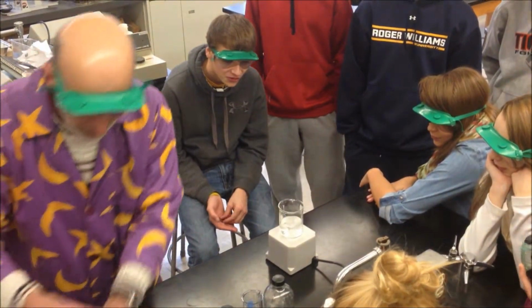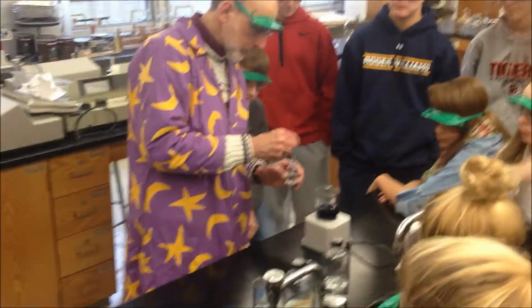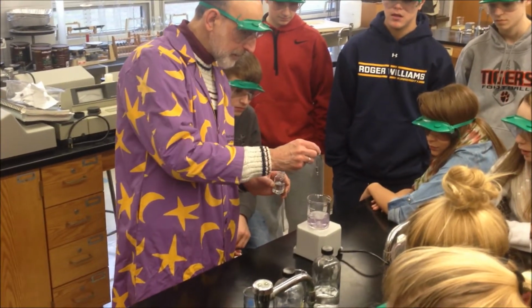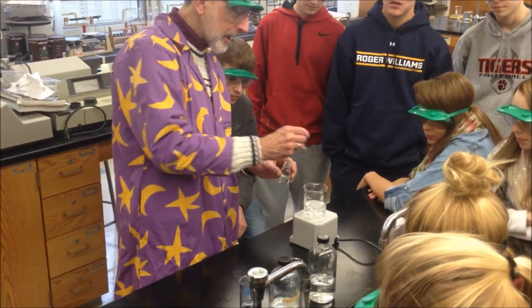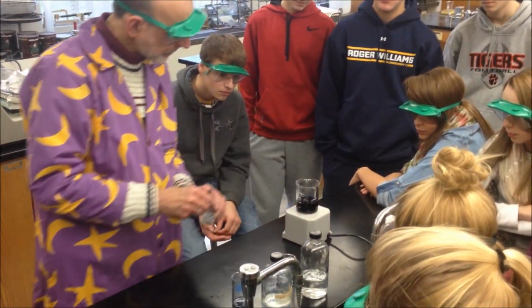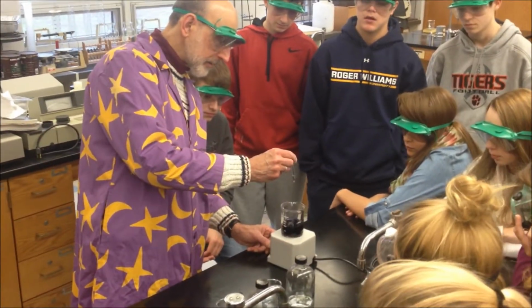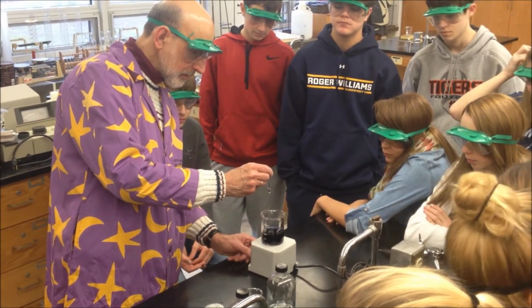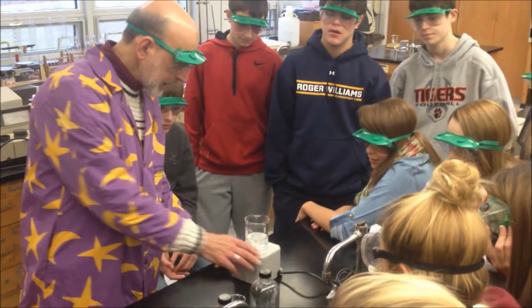Okay. If you get it just right, and the solutions are kind of touchy, they don't keep very well, so you have to keep them fresh. But if you get it just right, I told him to turn it purple, and he turned it purple. You can change it back and forth. But it's very complicated chemistry. So that's called the iodine clock. Okay, that's the first one.